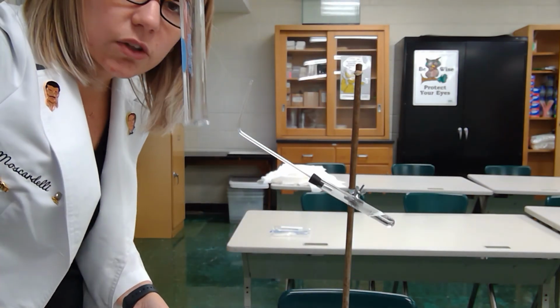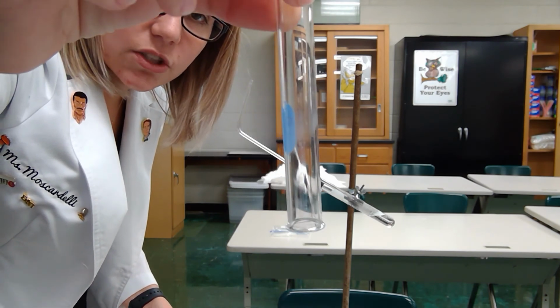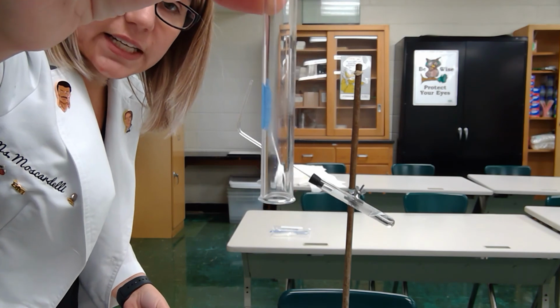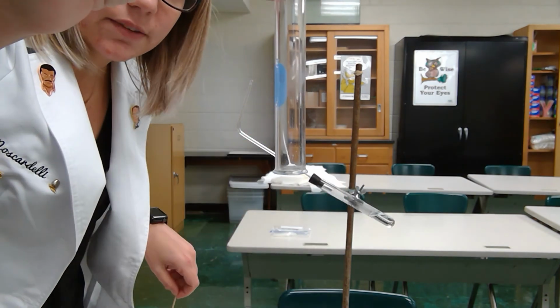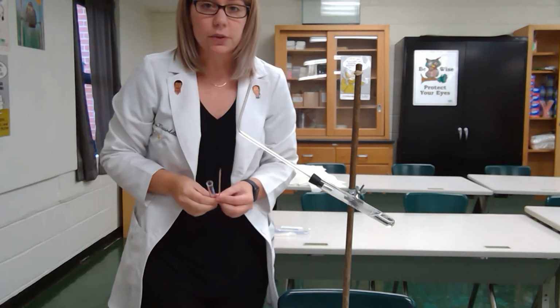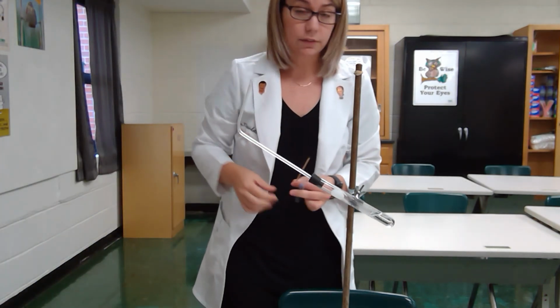If you look very closely to this clean test tube, you can kind of see condensation on the sides of that test tube, right about in the middle there. So those are your reactions and observations for the first and second stations of the Discovery Lab.